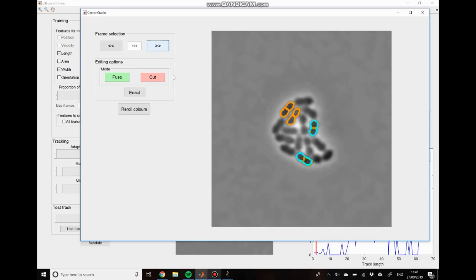Okay, so I've just spotted a good point to make at this time. So normally when you see a cell division taking place, you can see that we have this nice cyan outline at the time point before, indicating the end of the previous track. And then this nice dark orange line in between, indicating that at the next time point, you have these two separate cells.